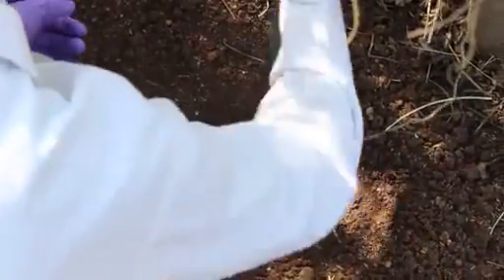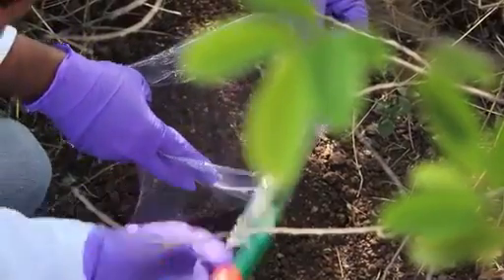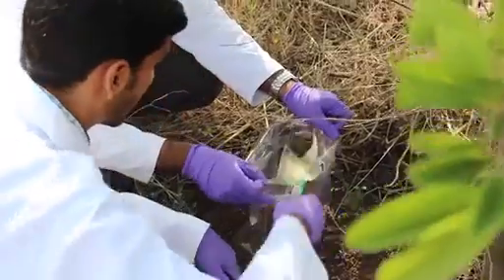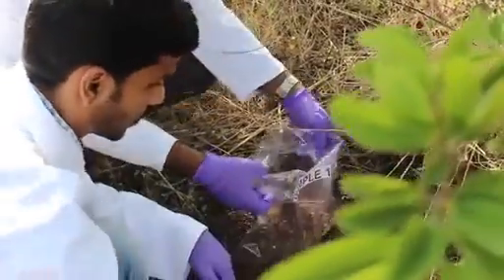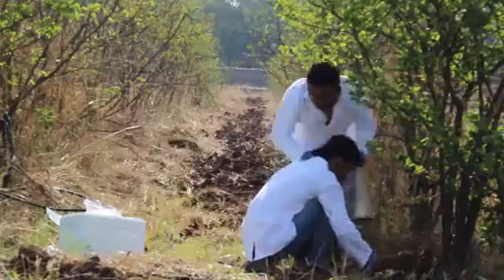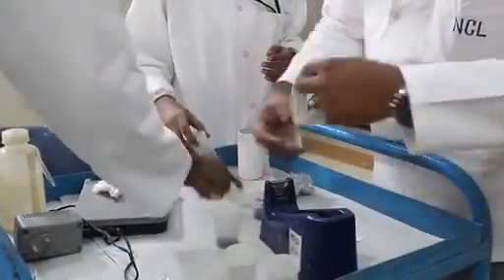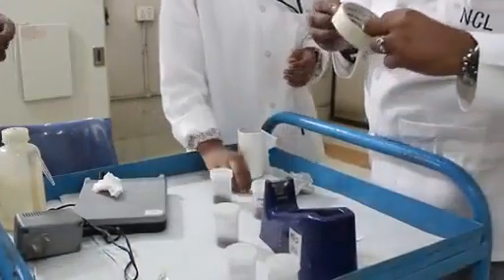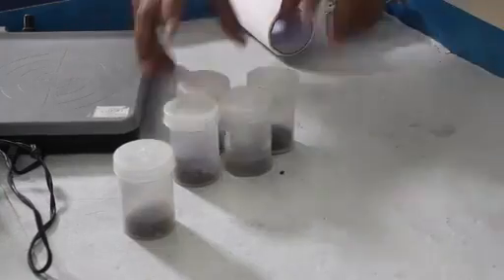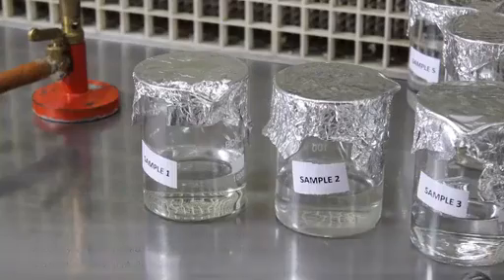The soil sample is taken from 4 to 6 inches below the surface. The samples from the field are collected in labelled bags, and later in the lab, 10 grams of each sample is transferred to vials. Metarhizium is isolated by the soil dilution plate method.